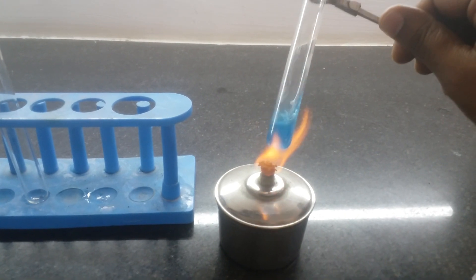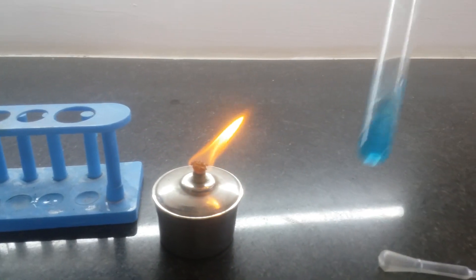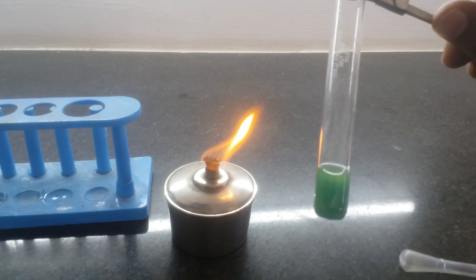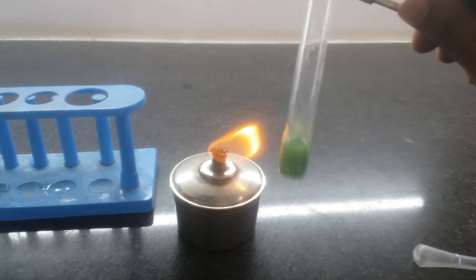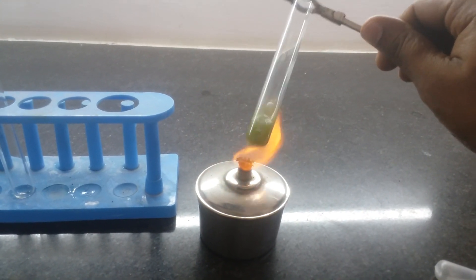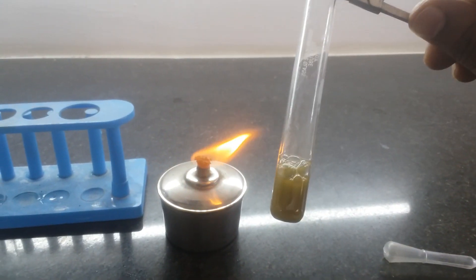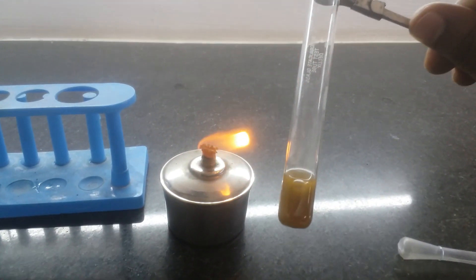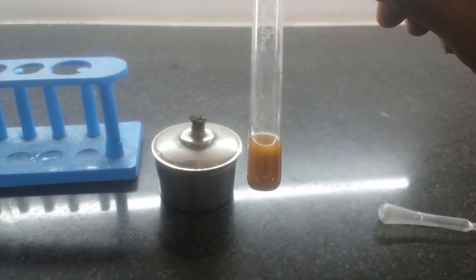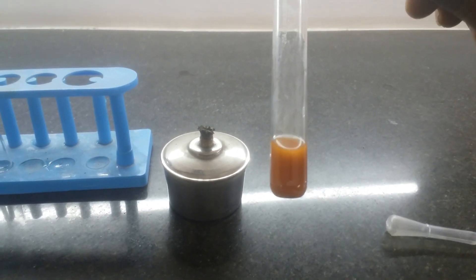Sometimes you have to shake in order to prevent it from boiling. You can see the change in color — slowly it is turning into light green, then dark green, then yellow, and slowly it will turn into the brick red color.